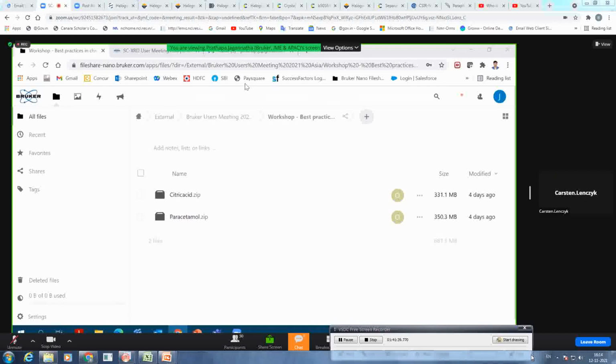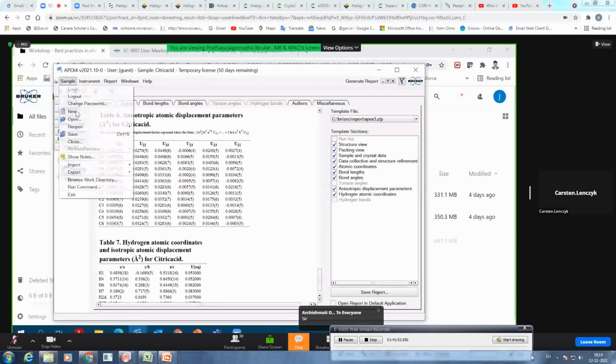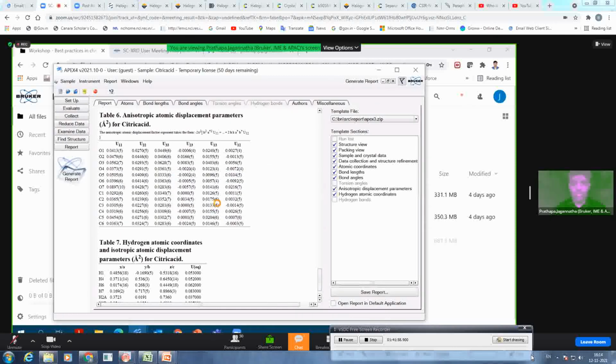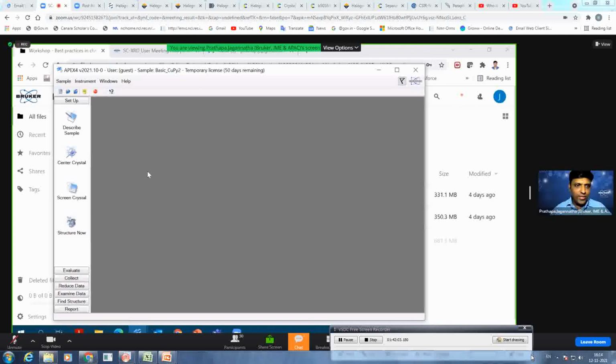Yes, okay. So there was one question. First of all, thank you, Pratap. Very informative. There was one question: if you could show once the face indexing, and then automatically there will be the option of numerical absorption available. I guess that's what they were asking by default. I hope I have enough information on this data. So let's see.